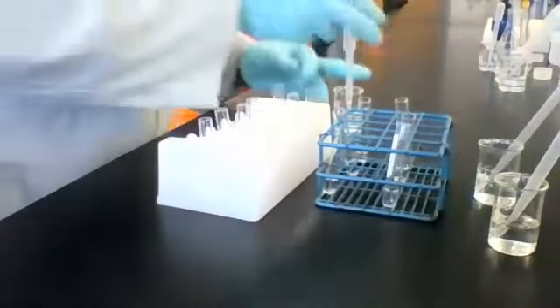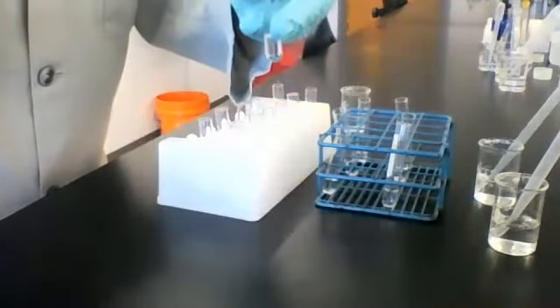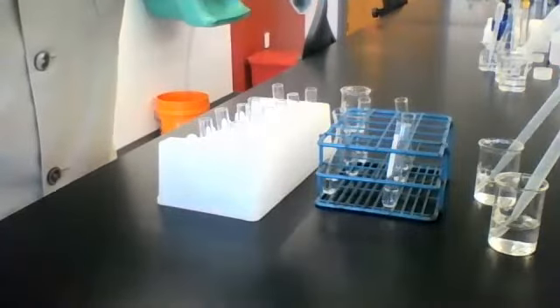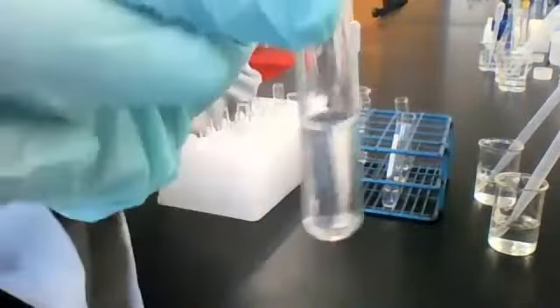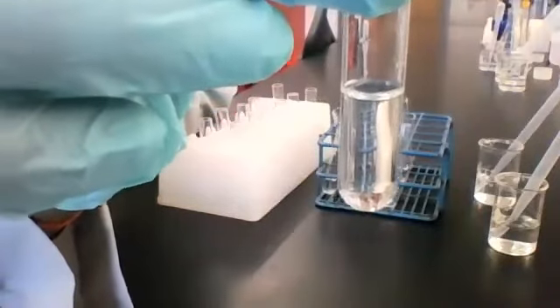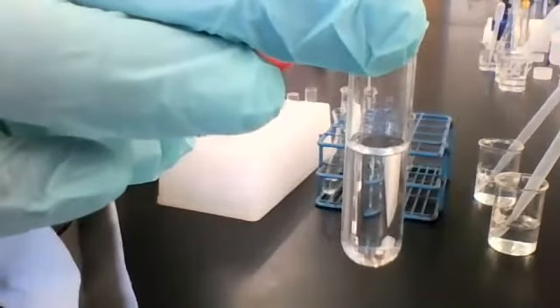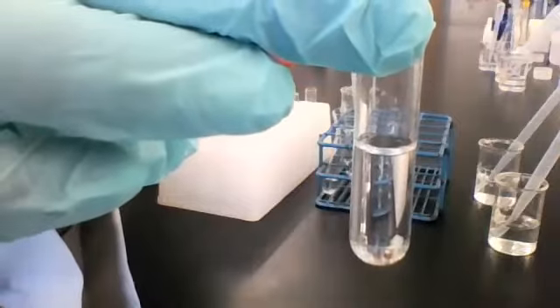All right, here's solution 2, which is Na2CO3, and I'm adding some of reagent A. Here it is. So this is solution 2 with reagent A. We all see that? I hope we all see that. Yeah. Okay, good.